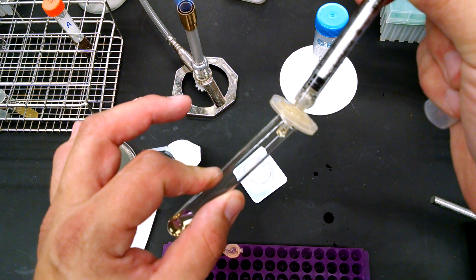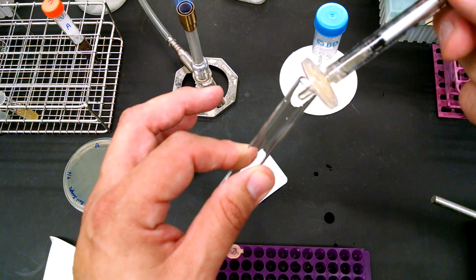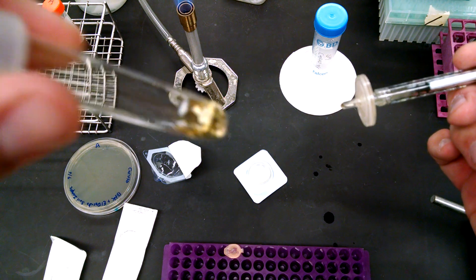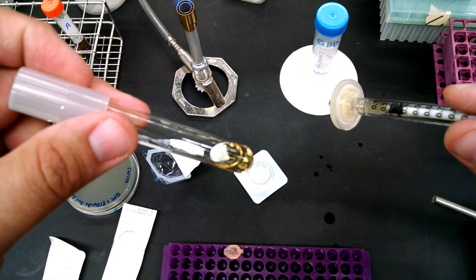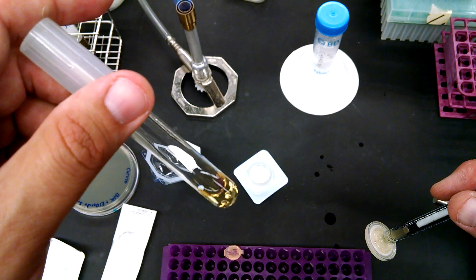Oh, I'm off the film. Push that through. All right. Let's see how well the filtration works. Ooh, look at that. Crystal clear. All the bacteria stuck by the filter. Here, no bacteria. That's what filtration does.